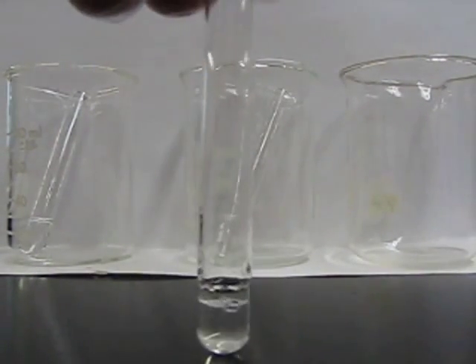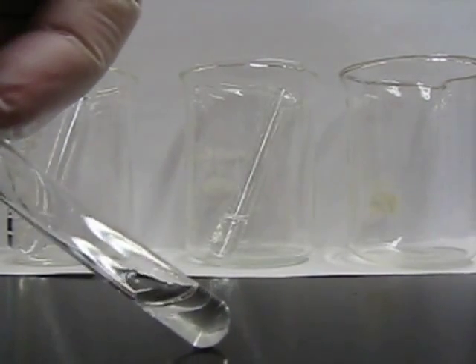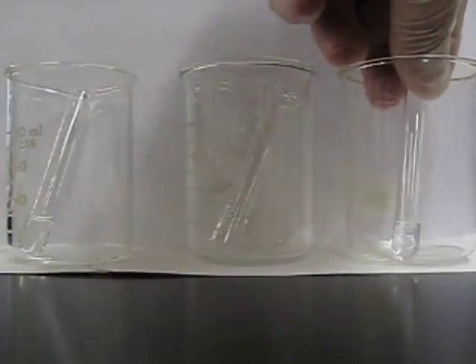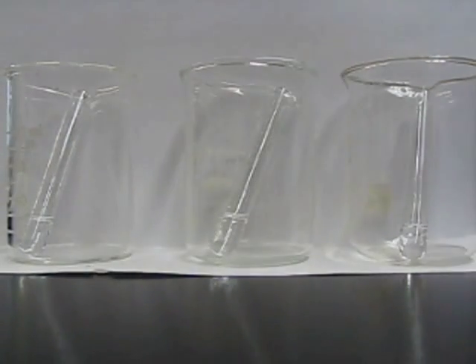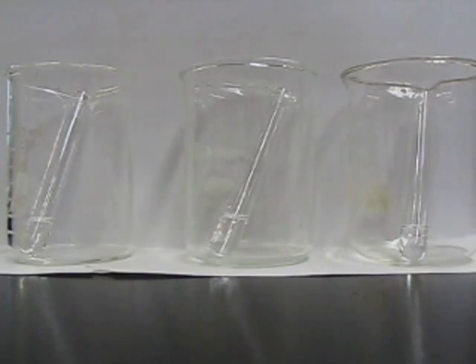In the case of the third one, we can see that there's definitely an organic phase on top of the water. So our solution on the left has the propanol, and our two on the right are one of the butanols, either 1-butanol or 2-butanol.